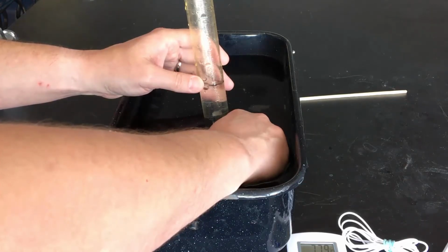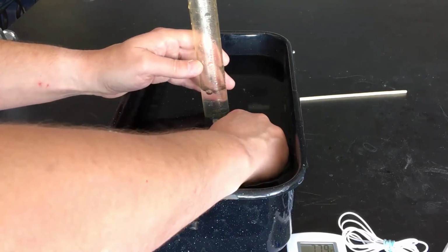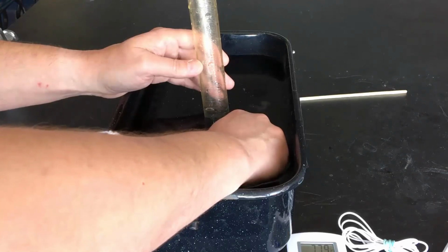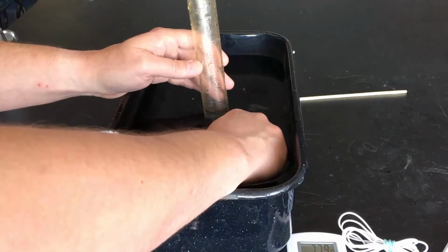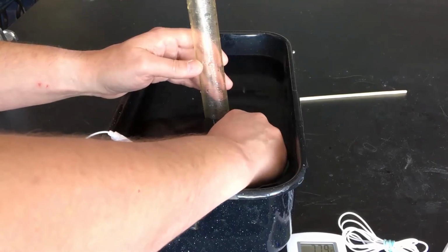Now, we don't want to have a tremendously large flame, but we would like to let out more butane. If you do this too much, you'll have an uncontrolled bleed of the butane, and we want to know exactly how much butane is still left in the lighter. We don't want it constantly bleeding out, because we want to account for the amount of butane that we actually used, not what's going into the air that we can't capture. Now, once we've gotten about 90 milliliters, we're going to go ahead and back off.